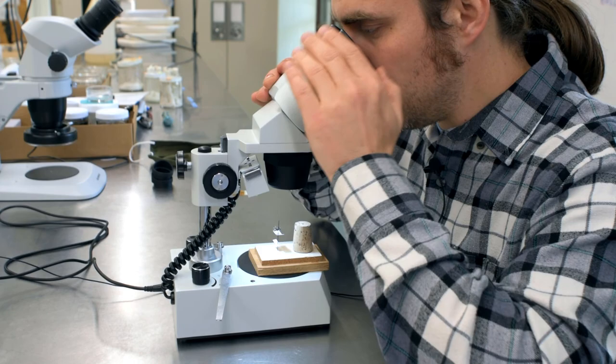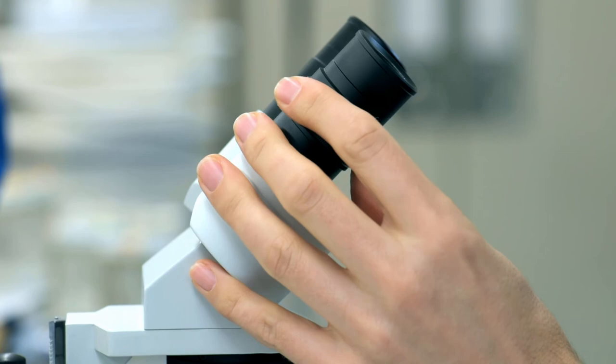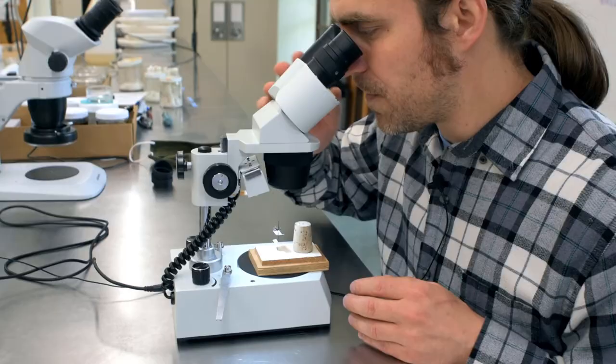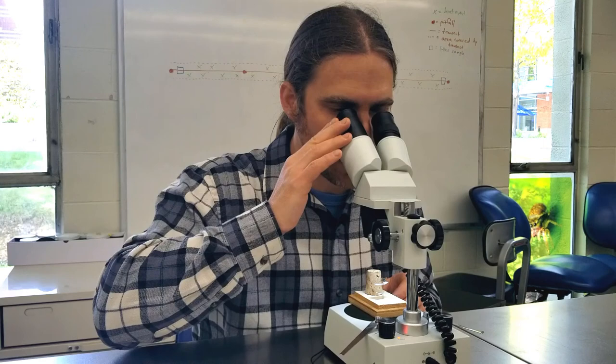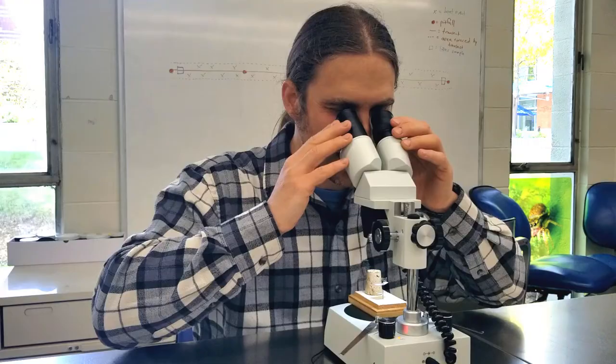Another issue is that one or both eyepieces can be out of focus. On this model, the right eyepiece doesn't change in focus while the left eyepiece can zoom in and out slightly to match the right. To fix this: look through the non-adjustable eyepiece (right side) and use the coarse focus to get it sharp. Then close that eye, look through the adjustable eyepiece, and turn it until it's also in focus. Open both eyes and everything should be crisp and at the same level.